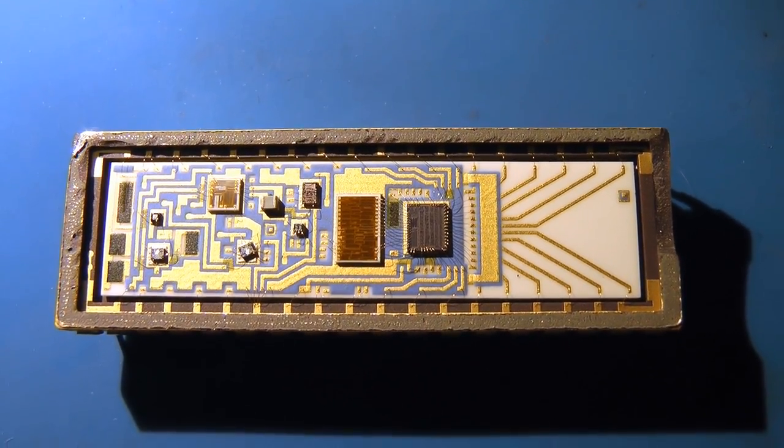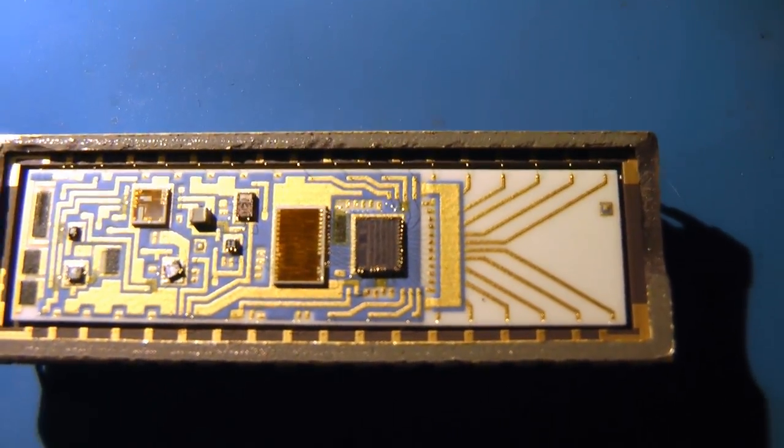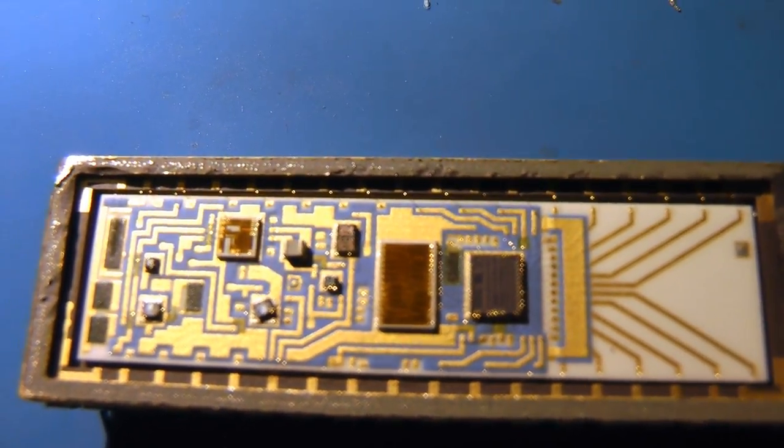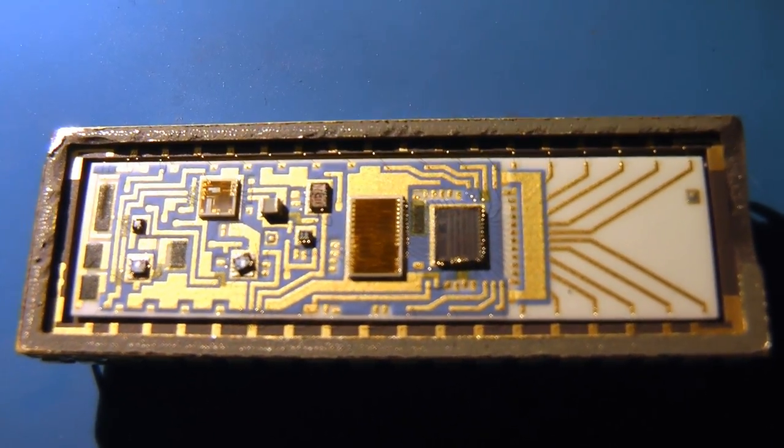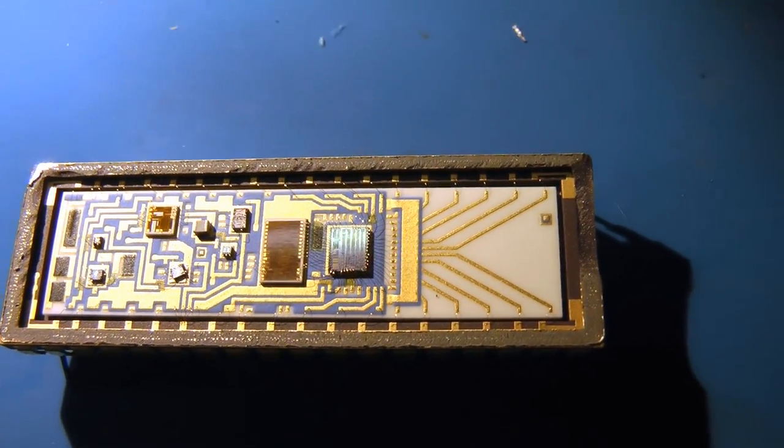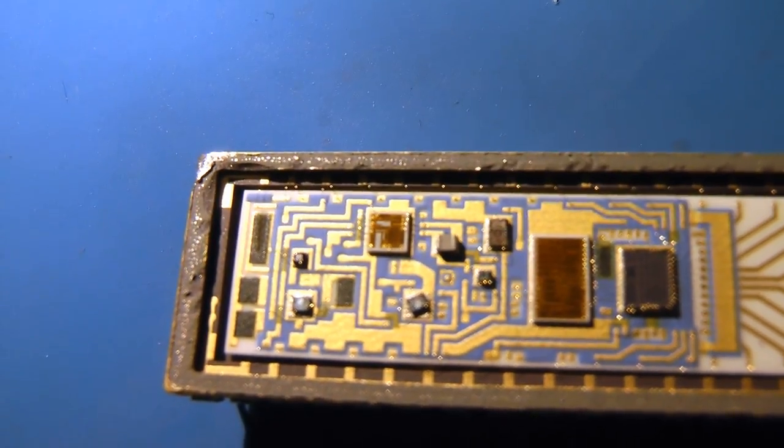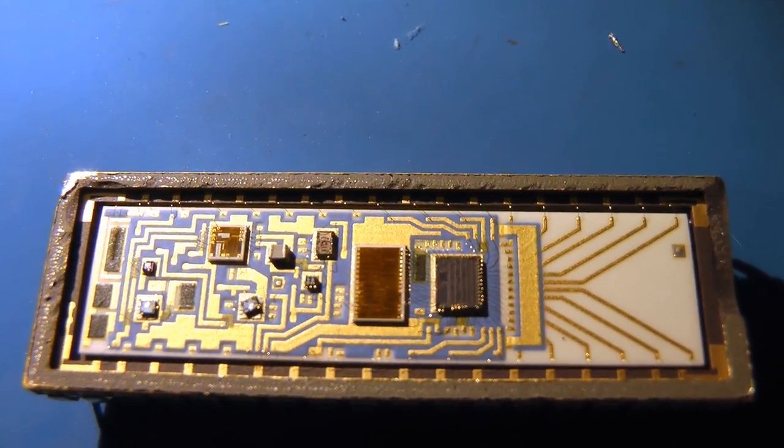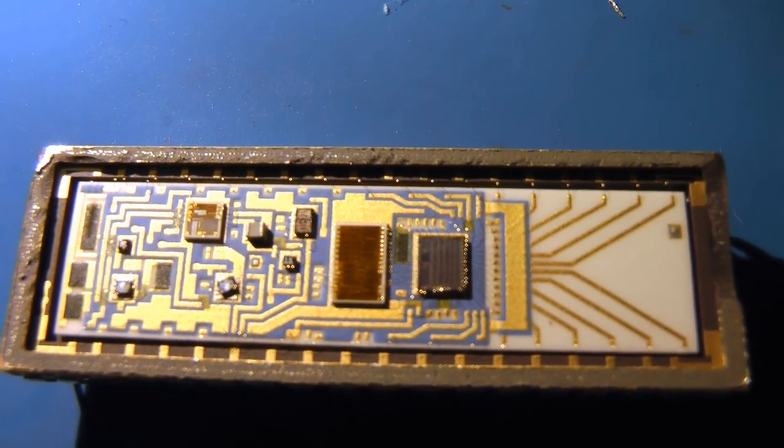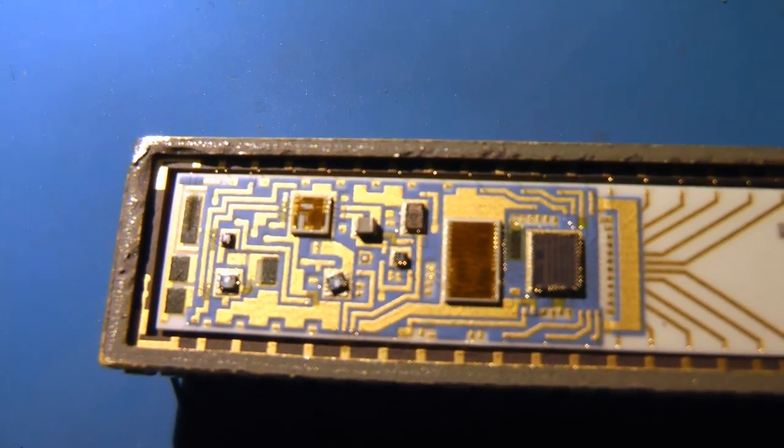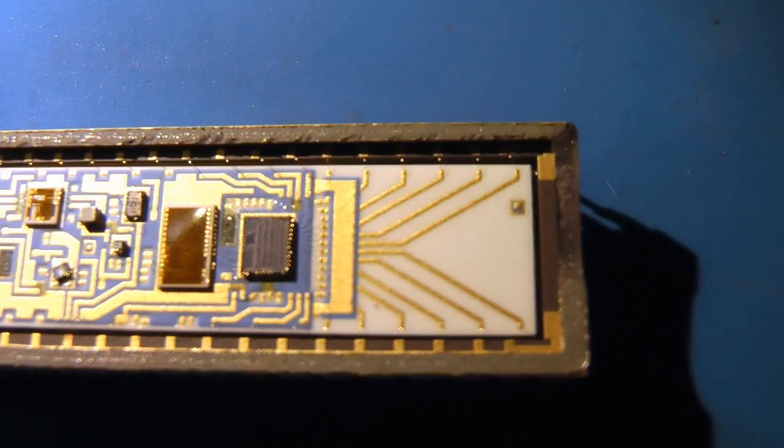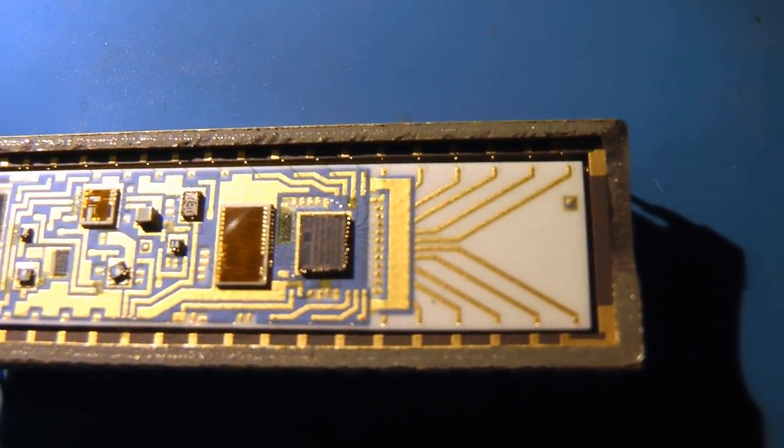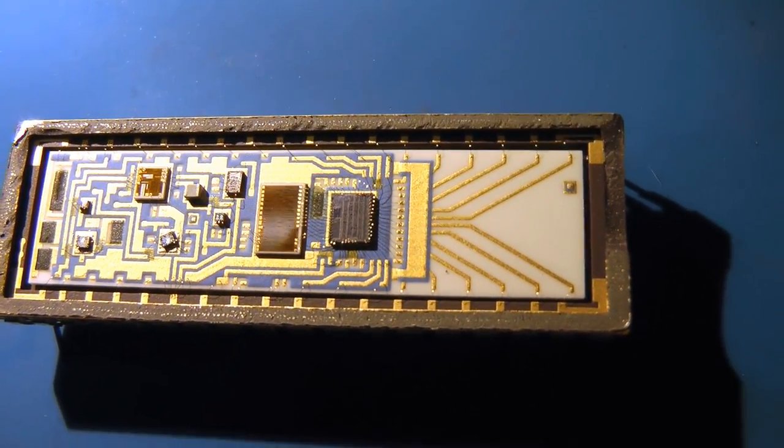So there is the inside of that chip. It is definitely a hybrid. It's got some sort of die there. And then these little sub-modules. The sort of brownish ones look like laser trimmed resistor modules. Sort of a whole other level. The large white portion here has some laser trimmed resistors on the side. Then there's these little sub-modules that are probably on ceramic boards as well that are also laser trimmed. And of course there's also a few small dies that are probably op-amps or diodes. So this seems to be something digital because there's these all these traces on the right that looks like a digital bus. And on the left it all appears to be analog stuff.